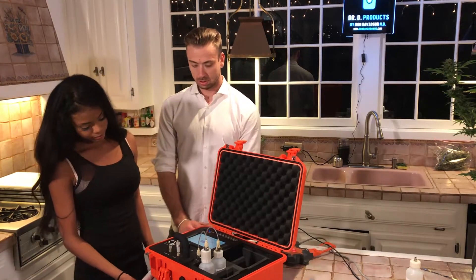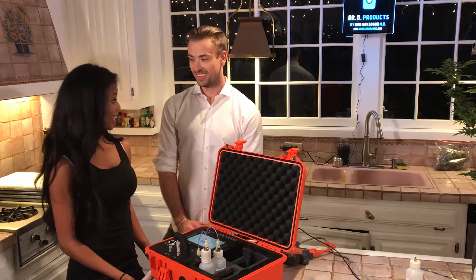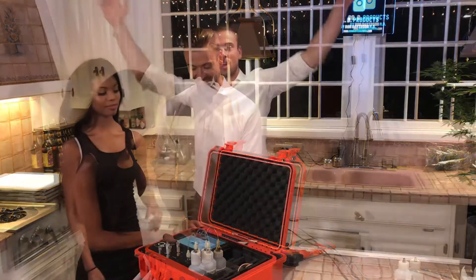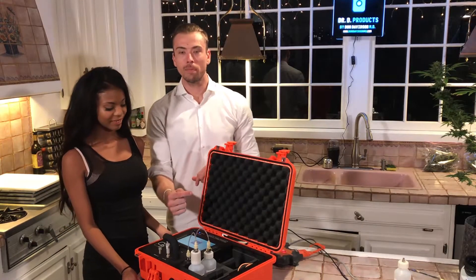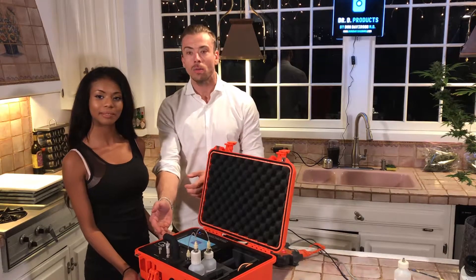So do you concur that we are ready to start the warm-up? Press the button. We just finished the warm-up, which flushed the lines, calibrated the peristaltic pump, and flushed the column.